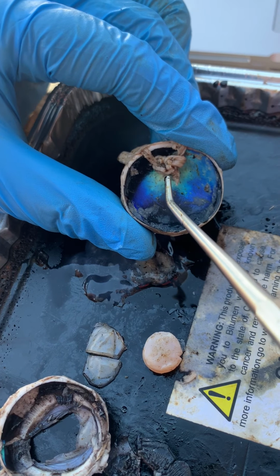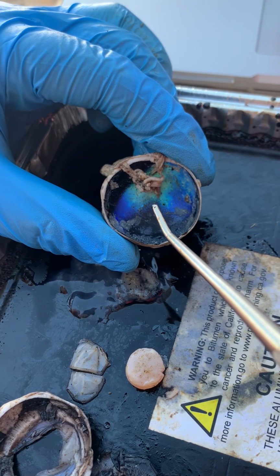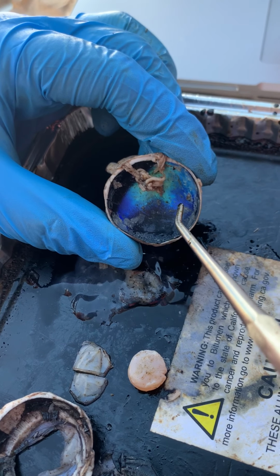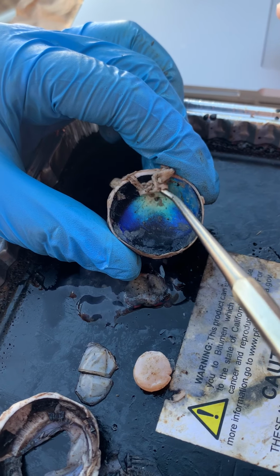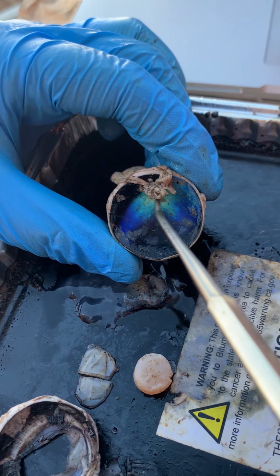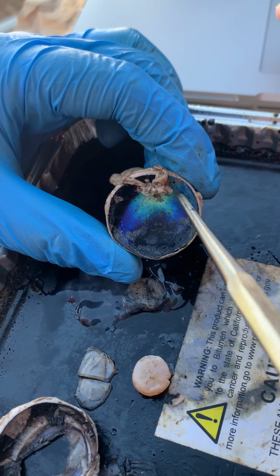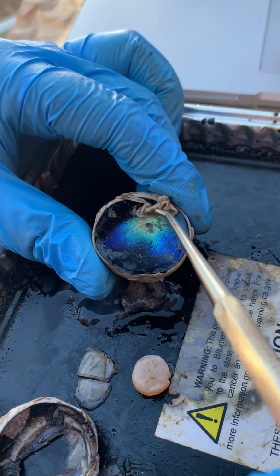The retina is made up of rods, which help perceive brightness and darkness and are seen in the peripheries, as well as cones, which help differentiate color and are seen only in the non-peripheries of the eye. The choroid, which is the black metallic-looking color in the back of the eye, helps transport nutrients to the retina as well as vessels and nerves to the ciliary body and iris.